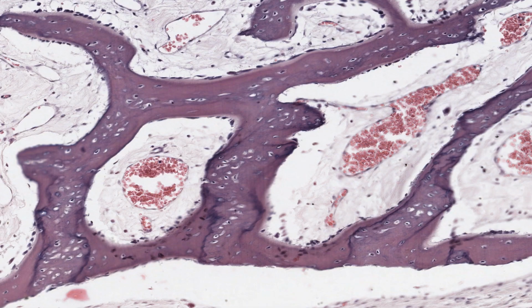Now this image is from another section of a bit more advanced intramembranous ossification, and it stains slightly differently. These bone spicules have patches of adult bone deposited on the woven bone. Look at these areas where the osteocytes are less concentrated. Woven bone has a higher concentration of osteocytes than mature lamellar bone and less mineral content, so often stains slightly lighter, although it's a bit hard to see in this image.